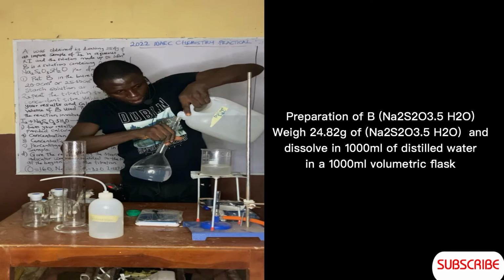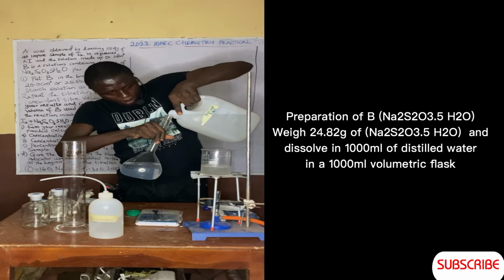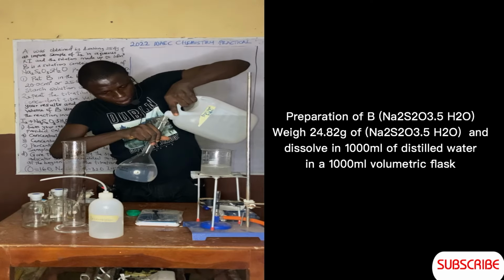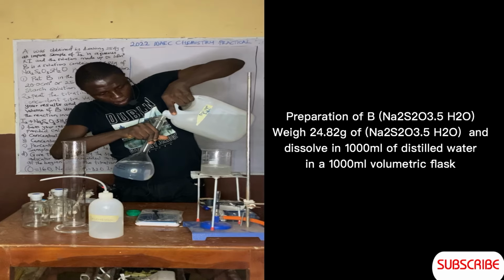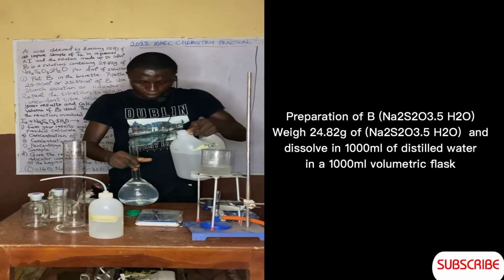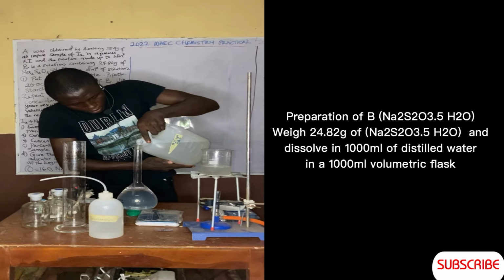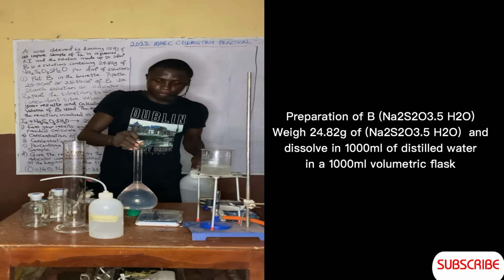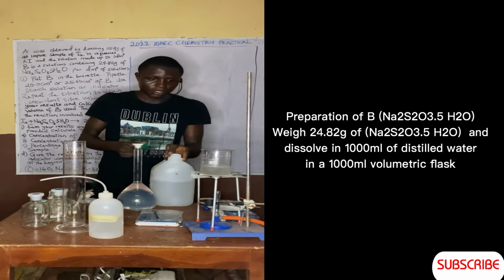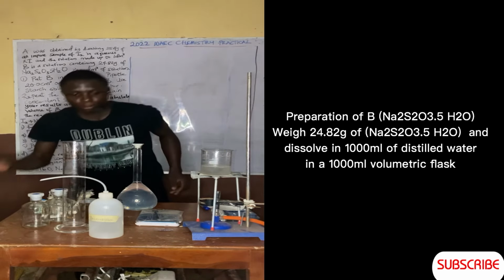careful. When you are almost there, you can use the distilled water in the wash bottle to fill the rest so as to avoid exceeding the mark point.